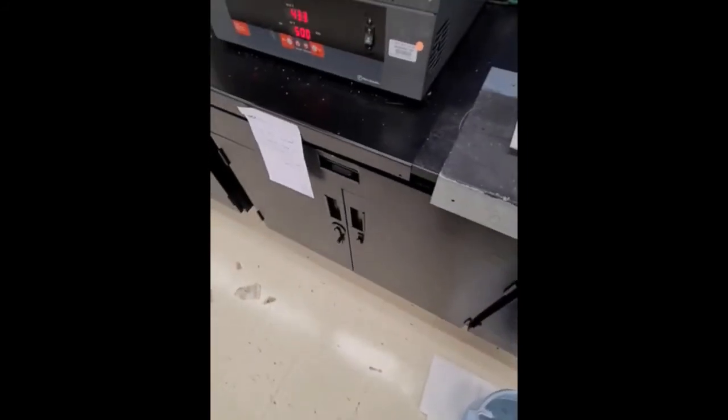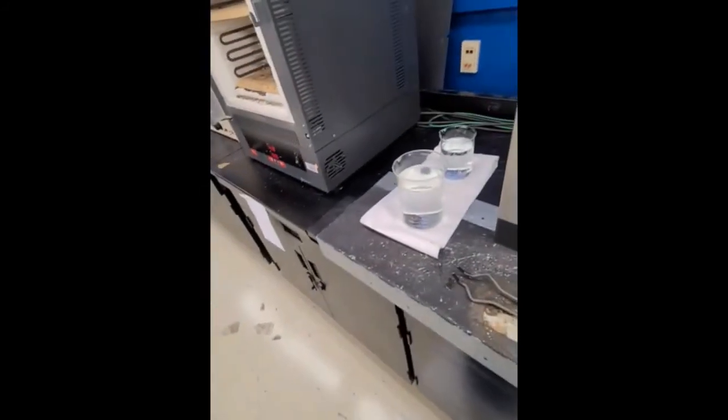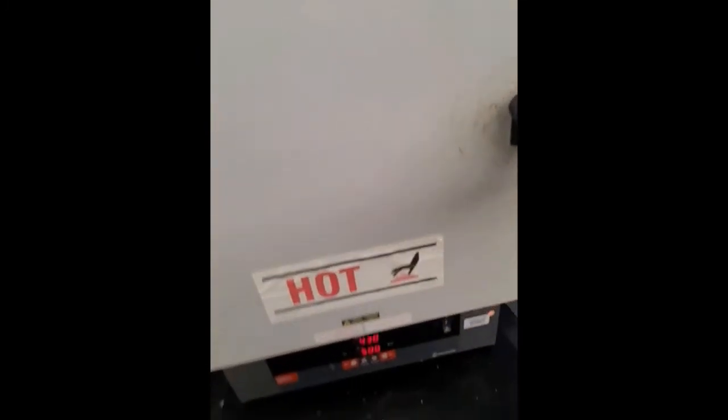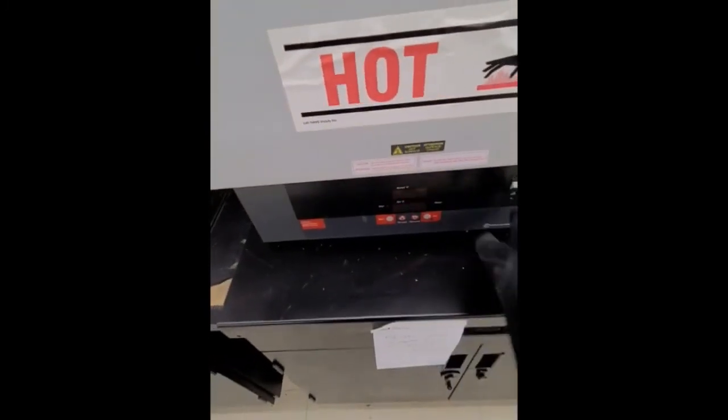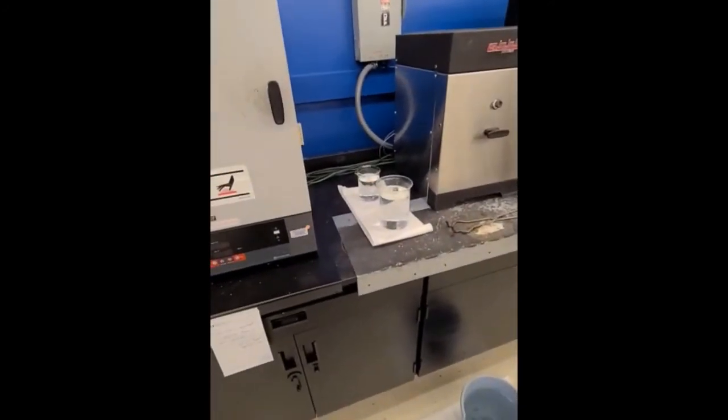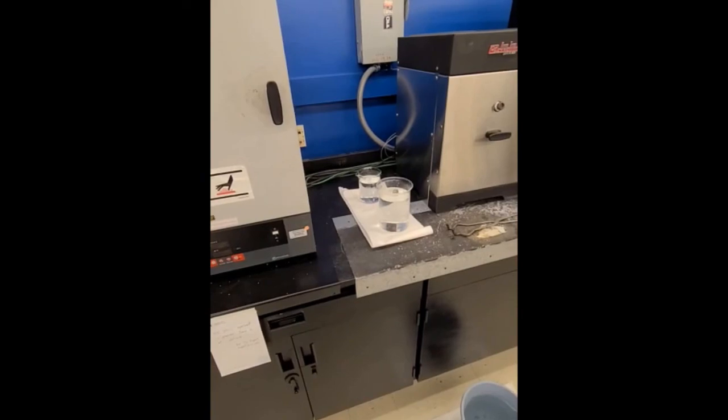You can look at this thing. I don't see any new bubbles coming up from it. So I'm going to put it in my clean water with no salt in it, and I can turn this off. Okay? So now we have all 3 of our samples, and then next week we can start to investigate their properties and microstructure.